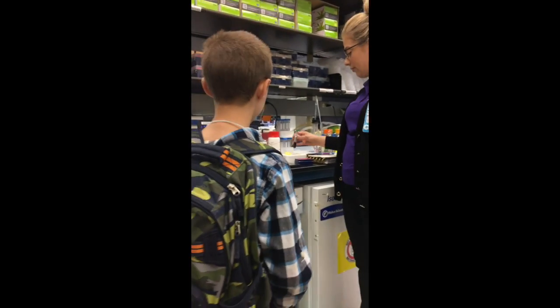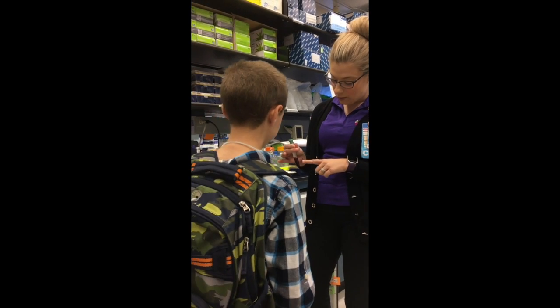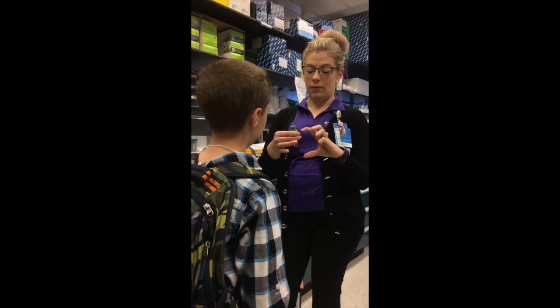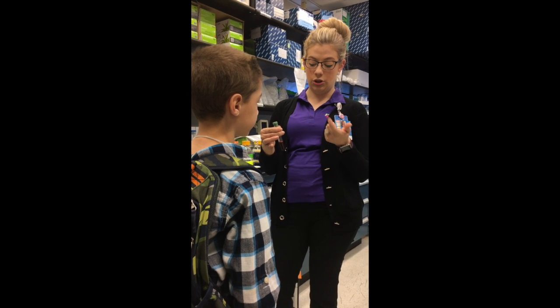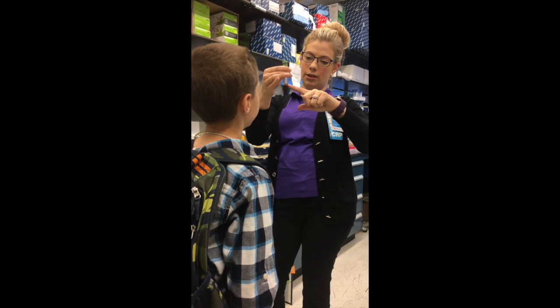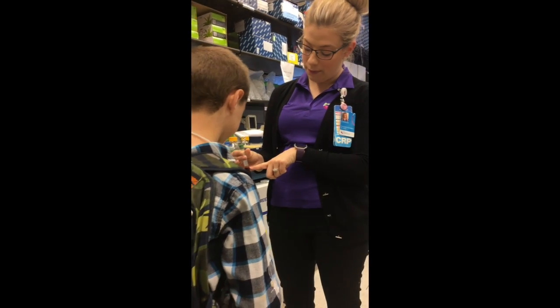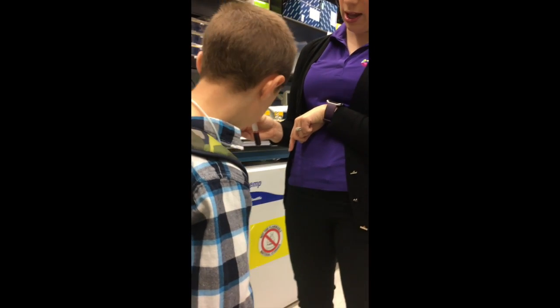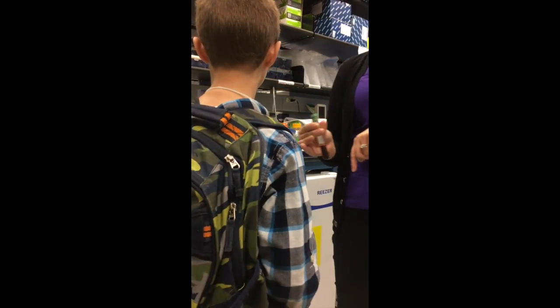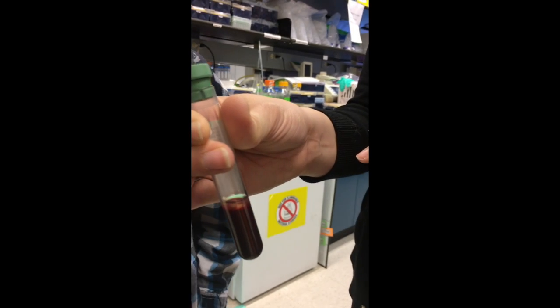Cool. So other things that we get from you when we ask for wonderful, beautiful samples is blood. We get a red top and a green top. The red top is processed immediately, so I don't have one to show you. The green top, we process the plasma off of it. Do you see the clear layer there? Yep. And then there's a white pellet sitting on top of the red blood cells. Do you see that? That's a white blood cell pellet, and that's where we get your DNA. That's the cleanest version of your DNA.